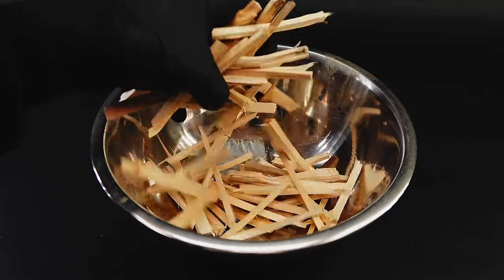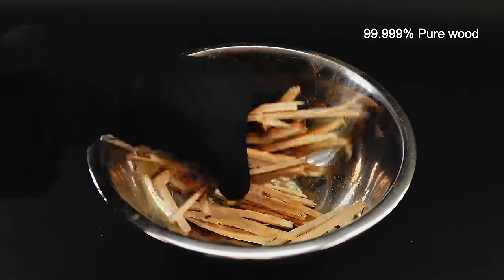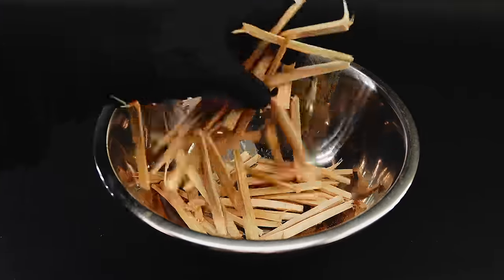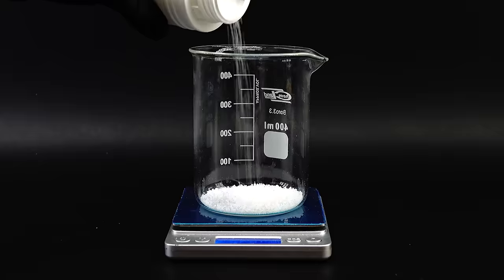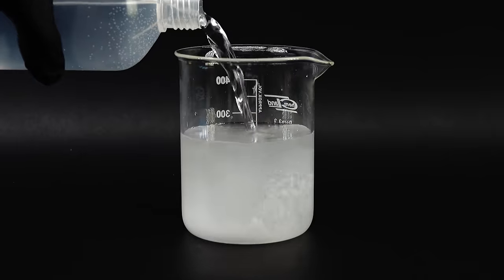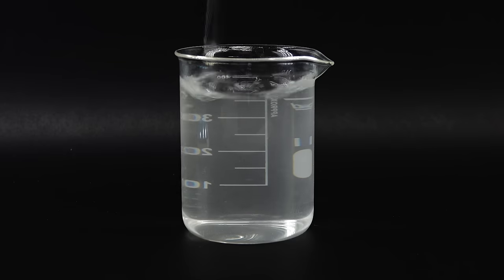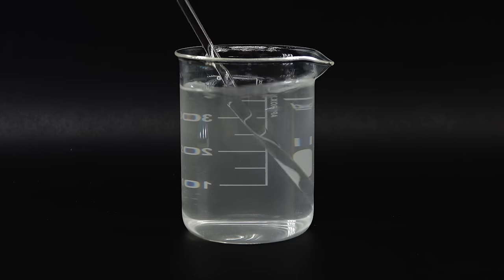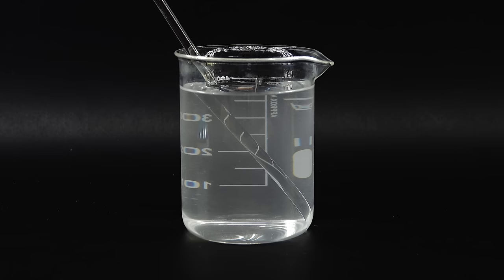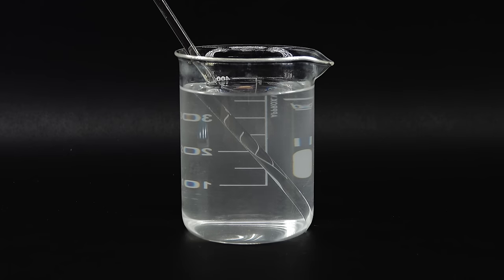With this ultra-fine, laboratory-grade wood ready, I can now finally bathe it in sodium hydroxide. To make the required solution, I weighed out 40 grams of it and dissolved it in about 350 milliliters of distilled water. This makes a roughly 10% sodium hydroxide solution, which from my research should both be gentle enough to not touch the cellulose, and eat through the lignin quite fast.